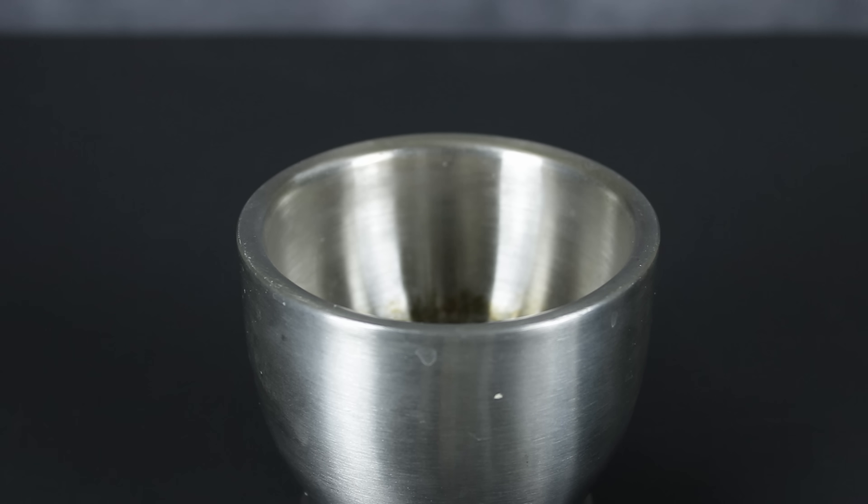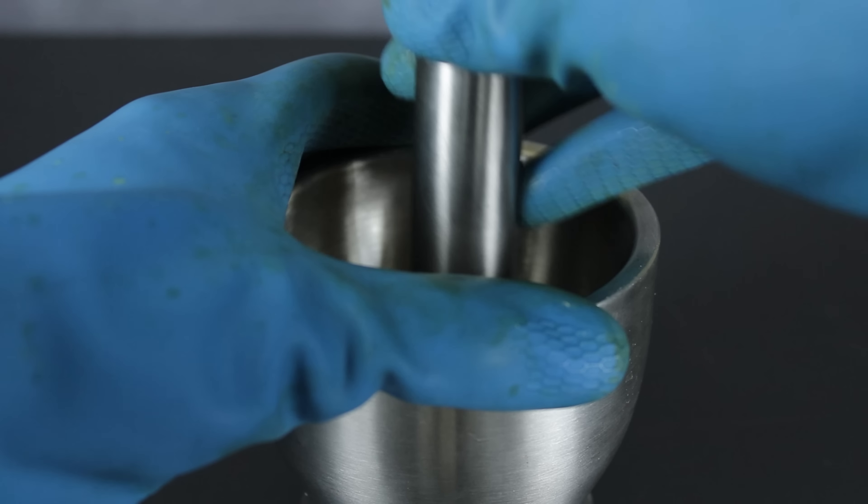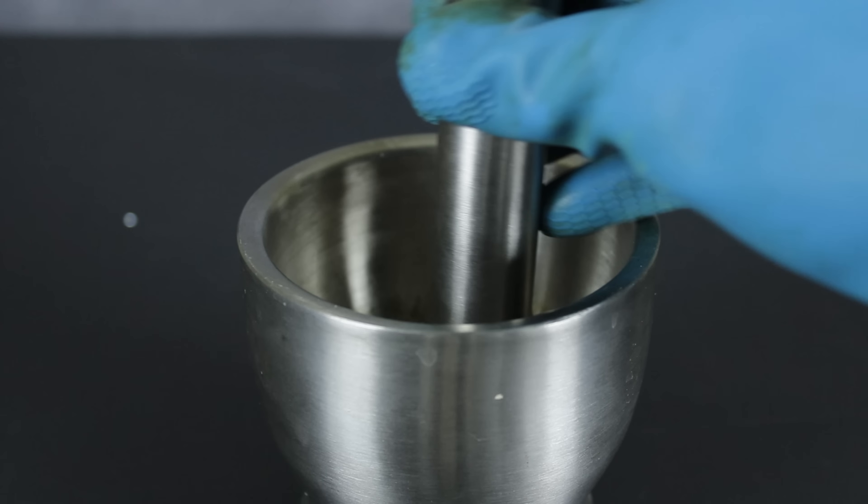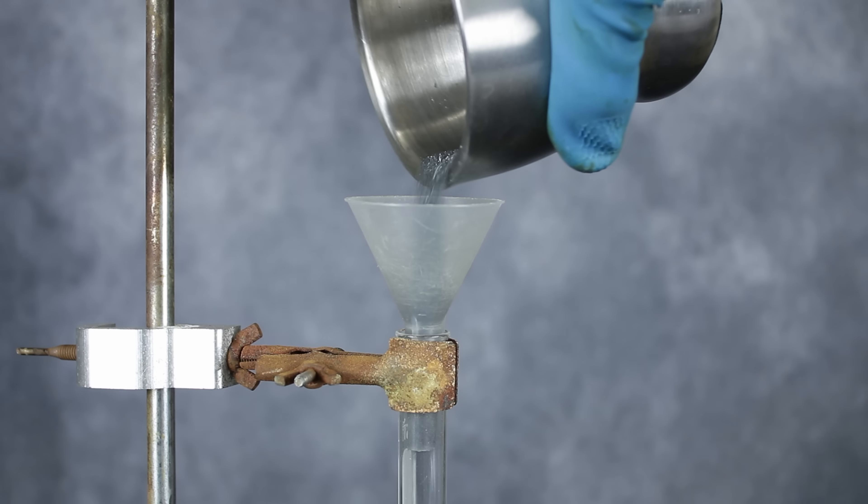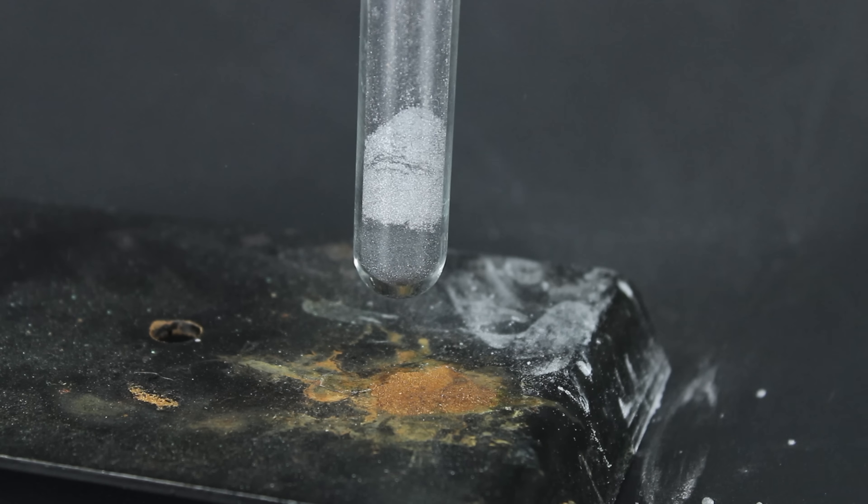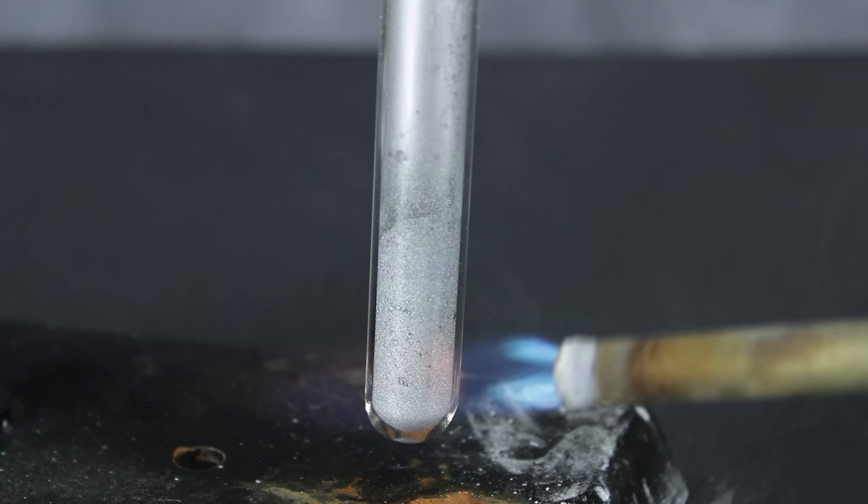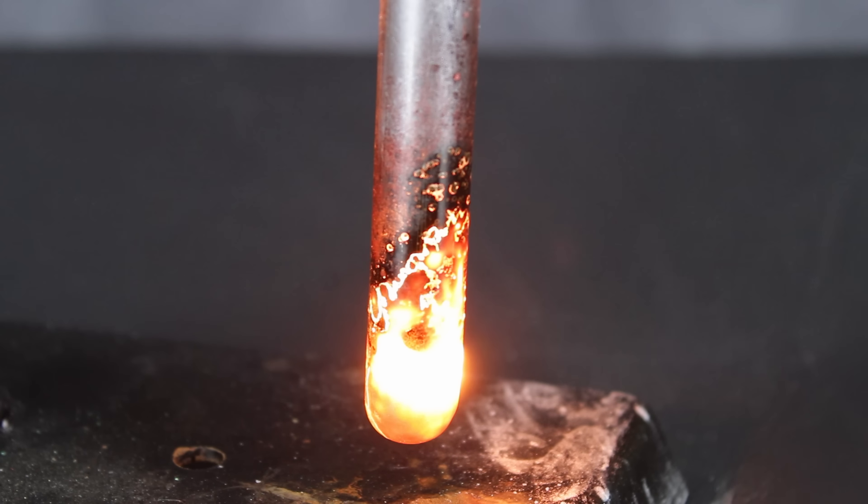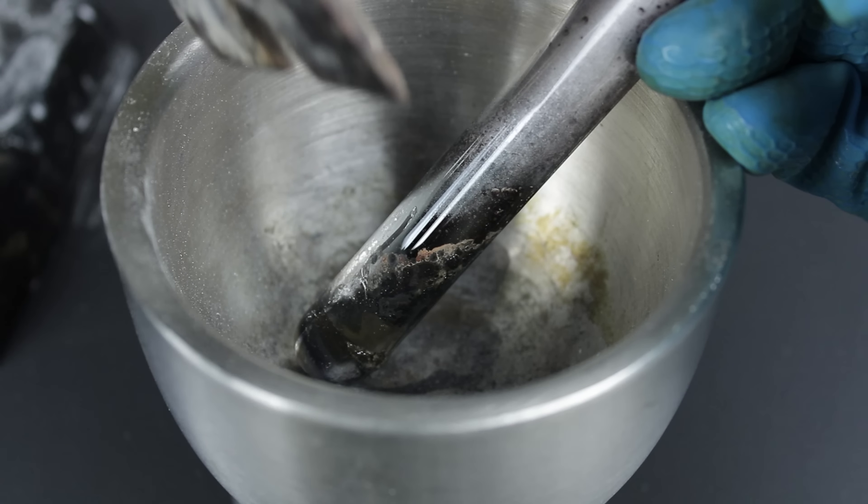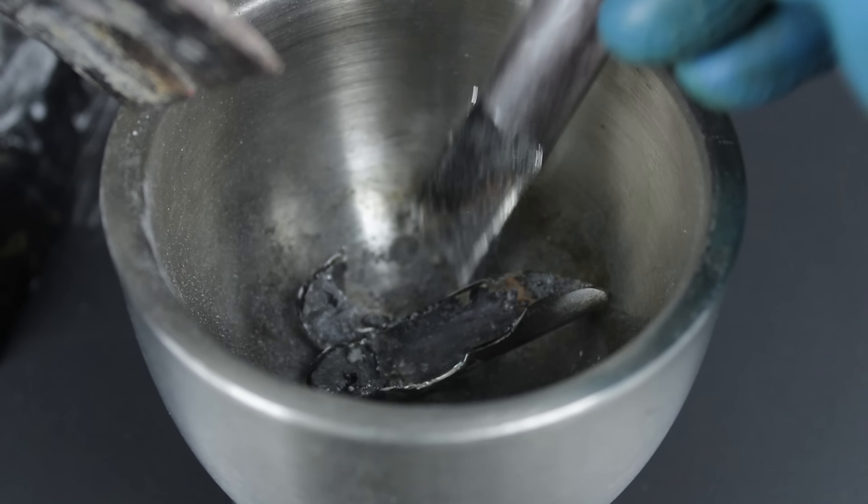So, I dropped it into my mortar and pestle, and ground it up into a fine powder. This wasn't actually too difficult, since selenium is about as brittle as rock candy. Once the selenium was ground up and added to a test tube, a few scoops of aluminum powder were mixed in thoroughly, and the main reaction was initiated with a bit of gentle heating from my blowtorch. As soon as the reaction cooled down, the test tube was cracked open and the fresh aluminum selenide was extracted.